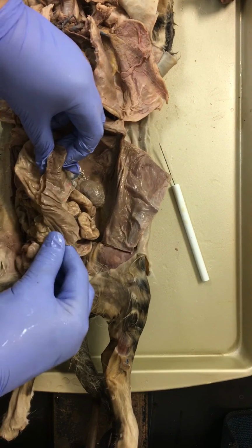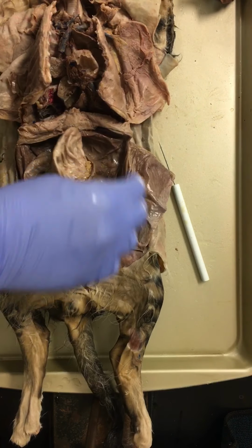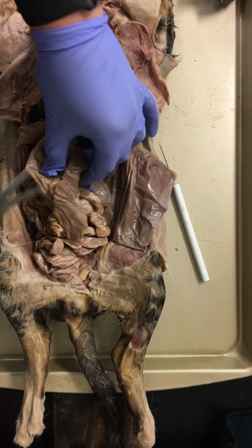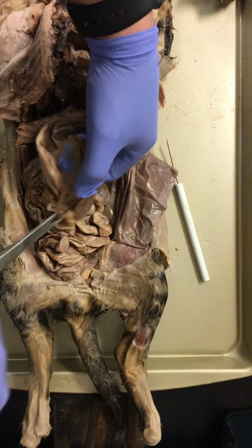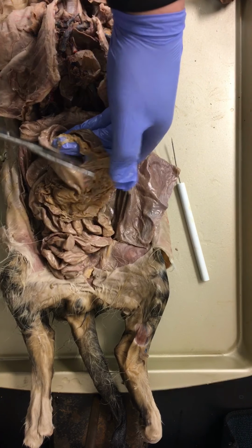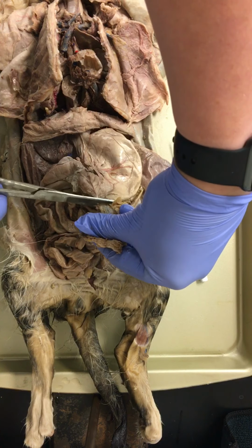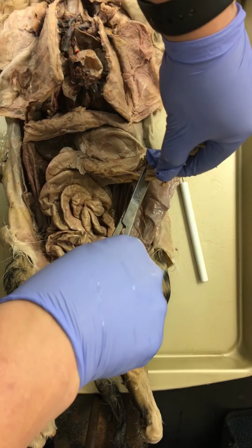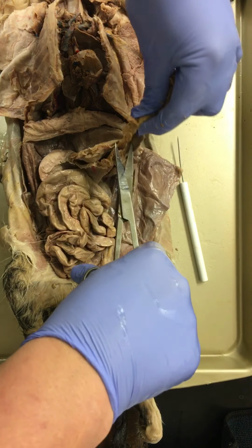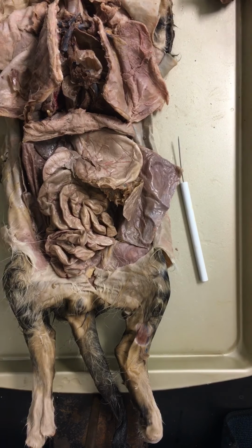Oh, very nice. On the back side of our stomach here, this is our spleen right here. I'm going to remove our spleen. Our spleen looks normal in size. It doesn't look enlarged, as it would if this cat was sick or had parasites. Oh, I should remove the greater omentum. Greater omentum covers the intestinal tract. Again, it's a layer, because remember we have true coeloms, so it's a layer of protective material.